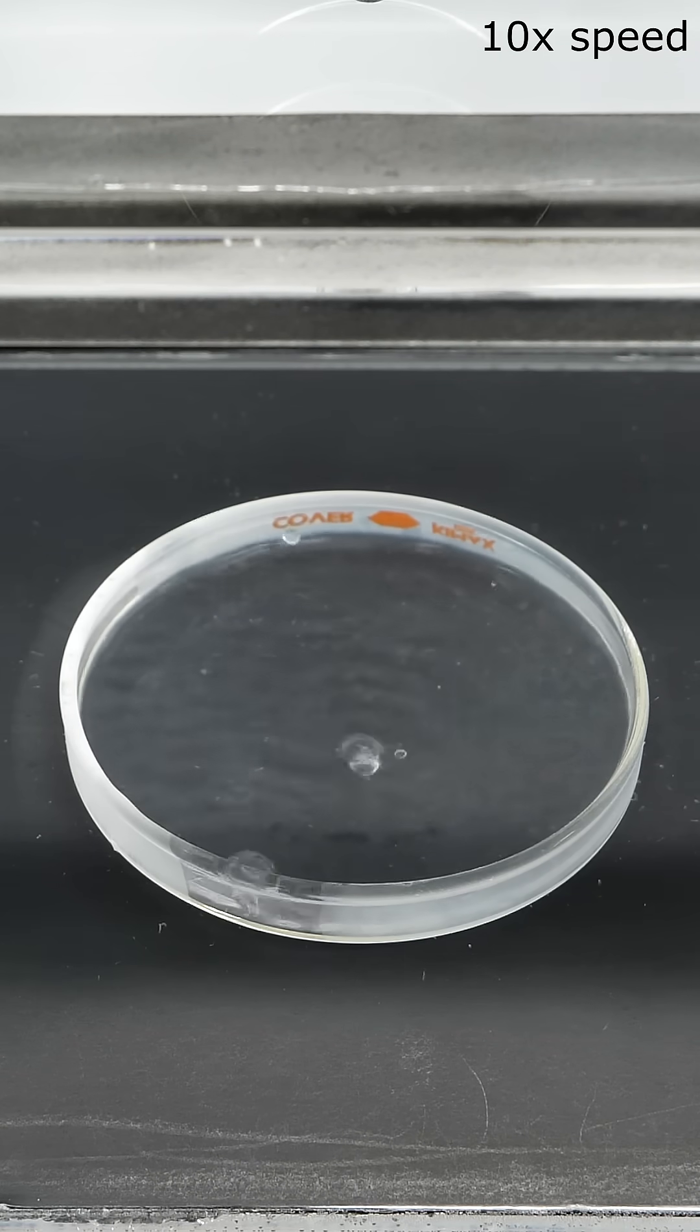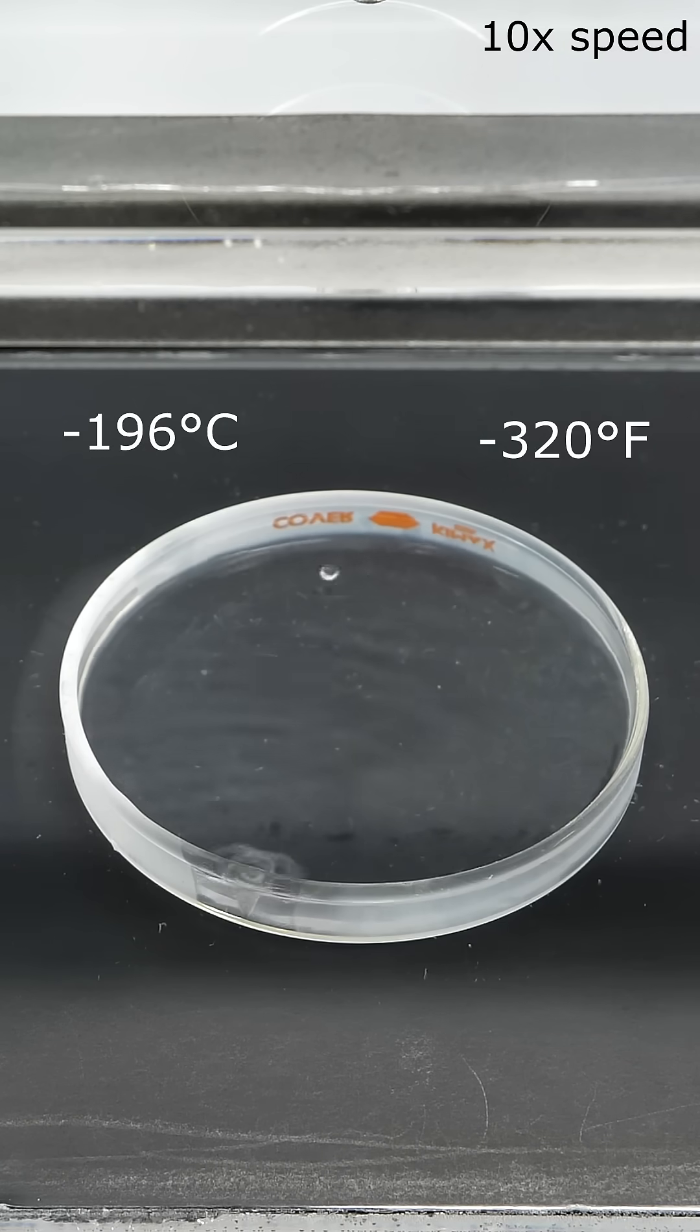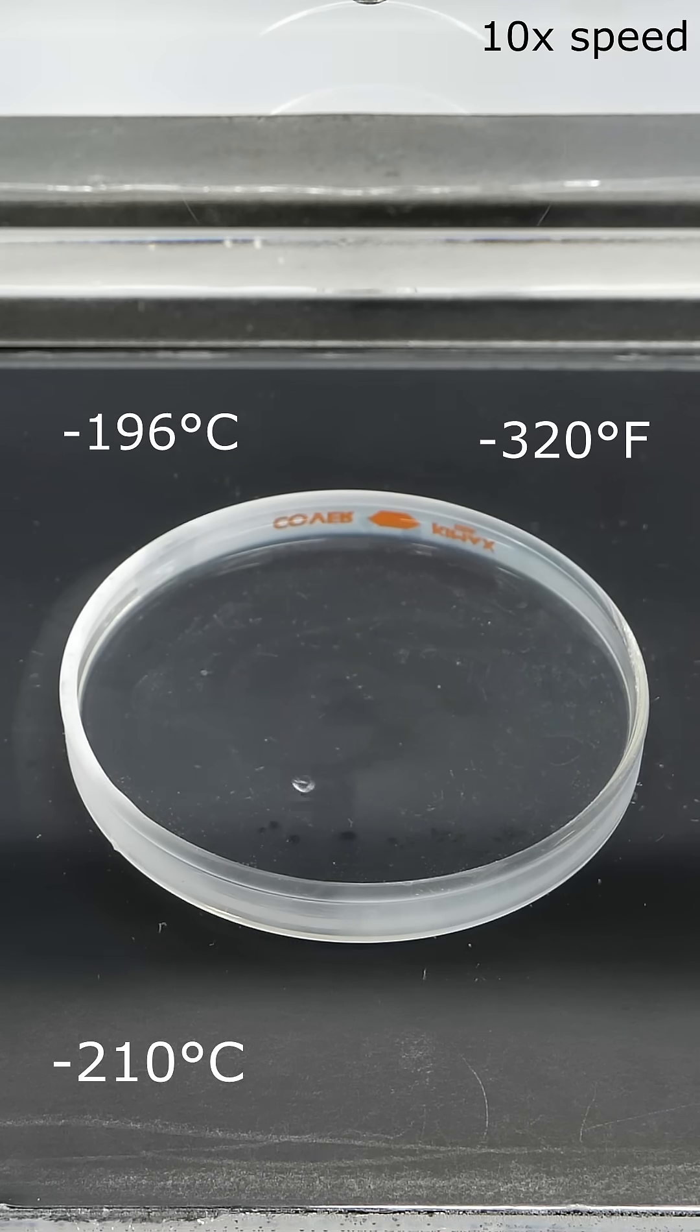In its liquid form, it's at negative 196C, or negative 320 Fahrenheit, but for it to freeze, it has to get down to negative 210C, or negative 346 Fahrenheit. But either way, now, assuming it's working, I pretty much just have to wait.